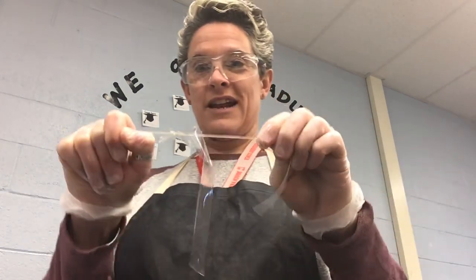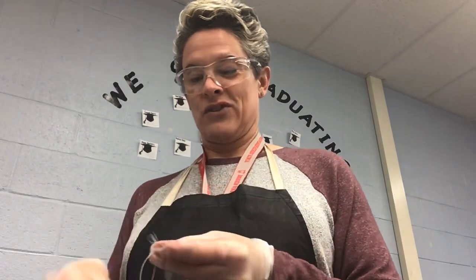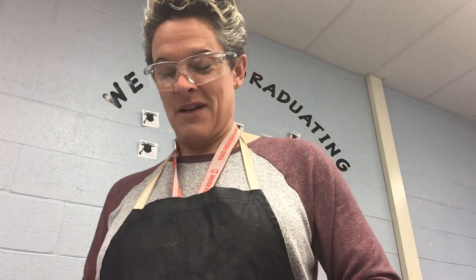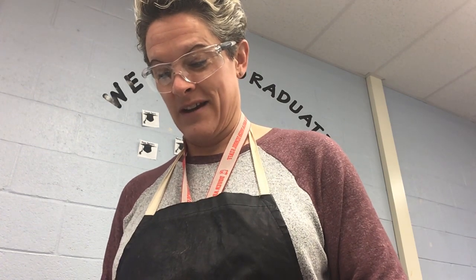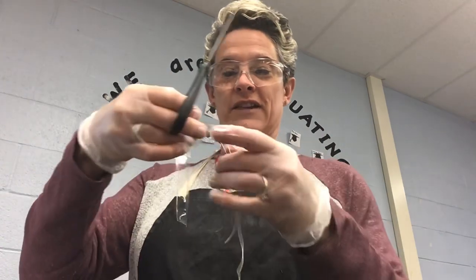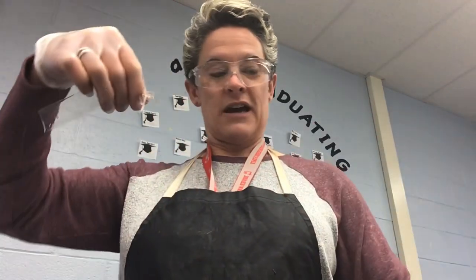Okay, so I've got a knot in the bottom of the dialysis tubing, and I'm going to tie a second knot just to make sure it's nice and tight so that we don't have things leaking out of my knot, because what we want is things to come out of the pores in the dialysis tubing, not out of my knot. So I think I have a knot there at the bottom. I am going to take my scissors and cut off the excess string here. So got a knot in the bottom of my dialysis tubing. So I'm going to soak this again.